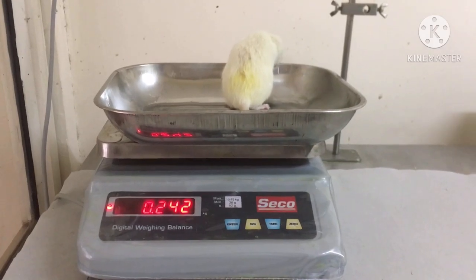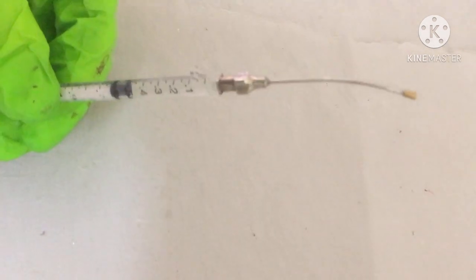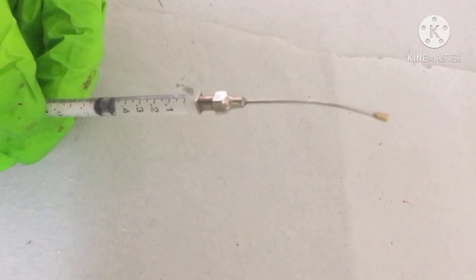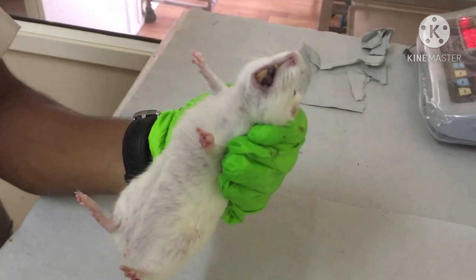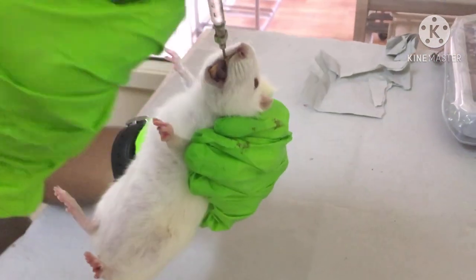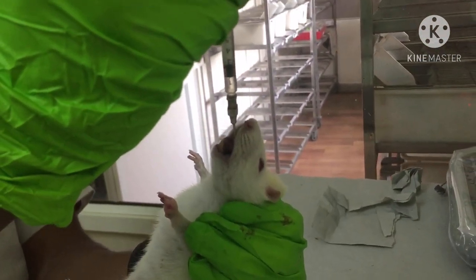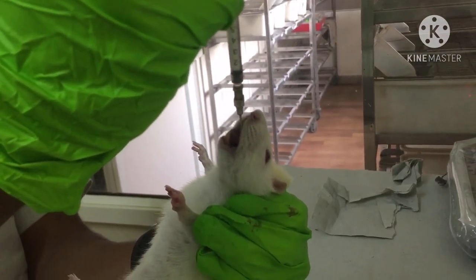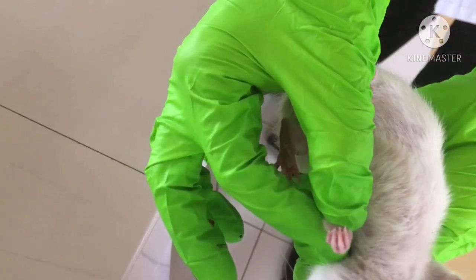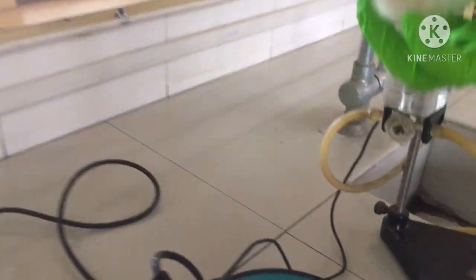Now we are taking the weight of the animal. For the control group, we are giving 0.5 ml of saline solution by the oral route. This is the paw from the control group — there is no inflammation. We have to dip this into the water cell.